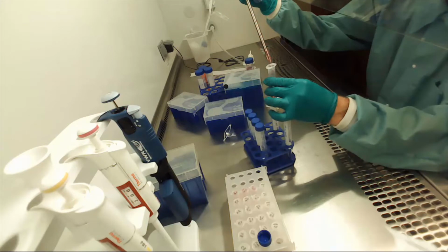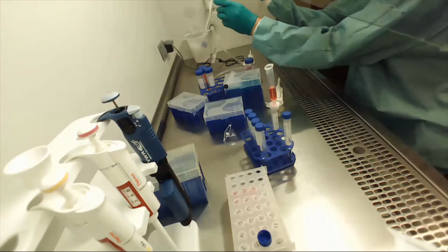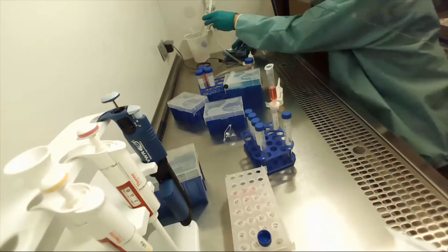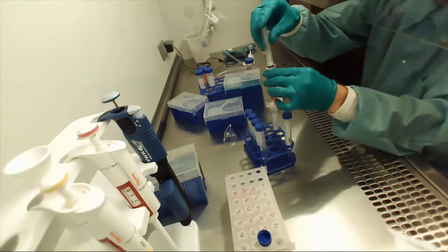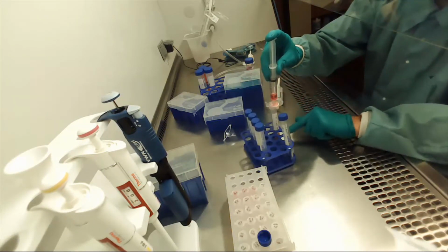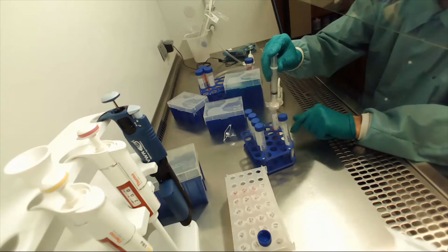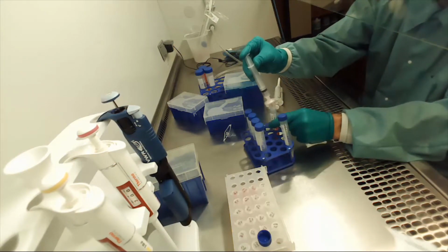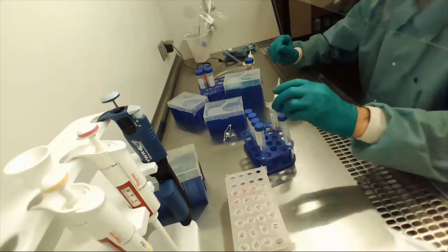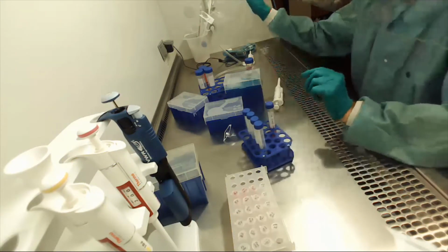So I'm just going to go ahead and put the liquid in there. Again, this balancing act is a little bit tricky, but it works. And then we can push through here. Again, the stuff that's in the syringe right now is not sterile. The stuff that we're pushing through this sterile filter that's going into our 15 mil tube is sterile. Okay, and it appears I pushed all the liquid that's going to go through, so we're good there. Put this cap back on. Okay, we no longer need that one.